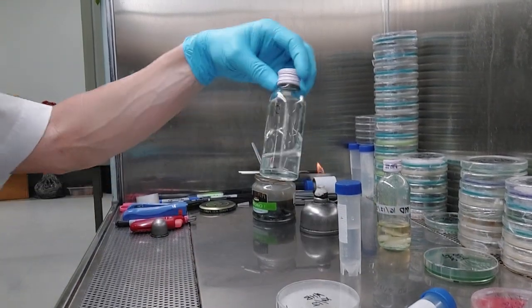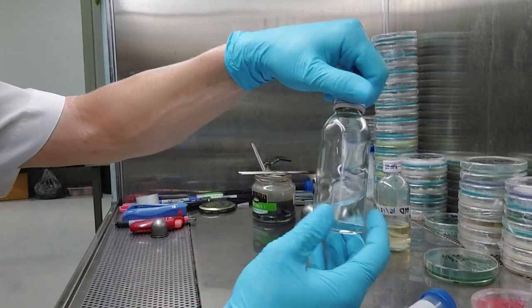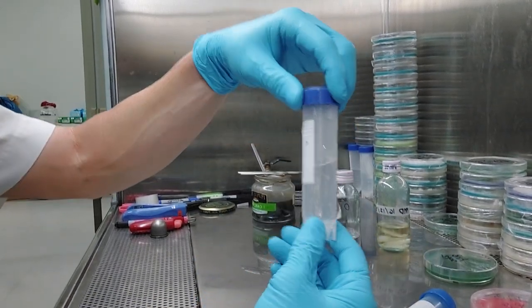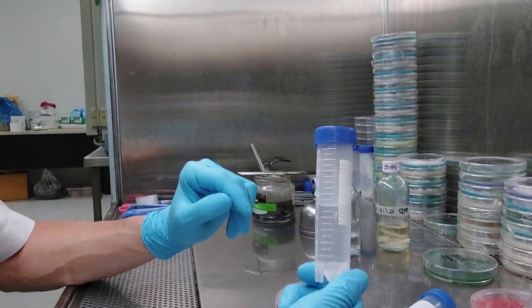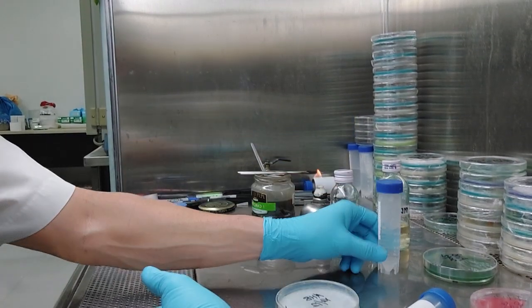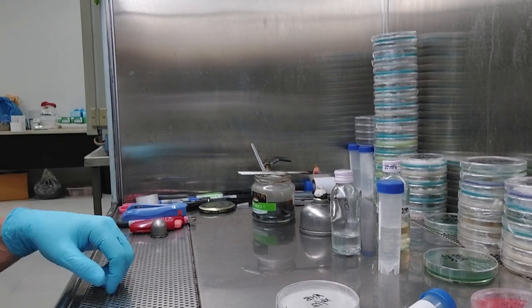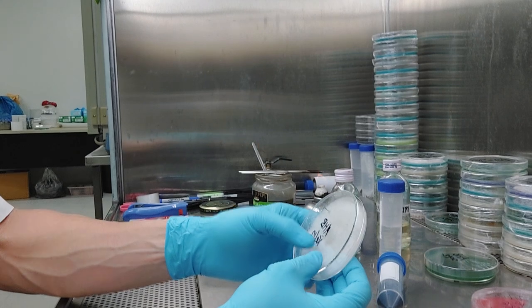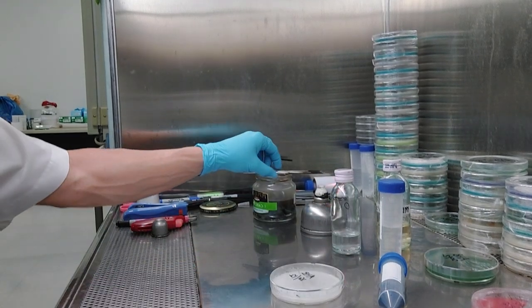So you guys, I'm saying, man, these bottles, these are like leftover drink bottles, like sports drinks, they're glass, they're free, they're garbage basically. Now, if you want to get fancy and spend a quarter on one of these, these work perfectly fine too. Anyhow, let me just do it. So what I'm going to do, here we go, fully colonized plate. I normally wouldn't let it grow to the edge, but this one again is about two months old and I need to do something with it.